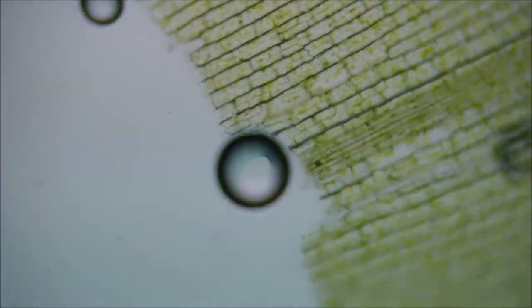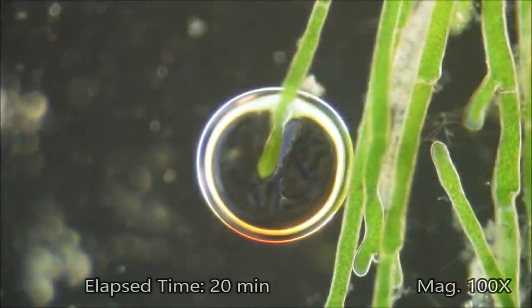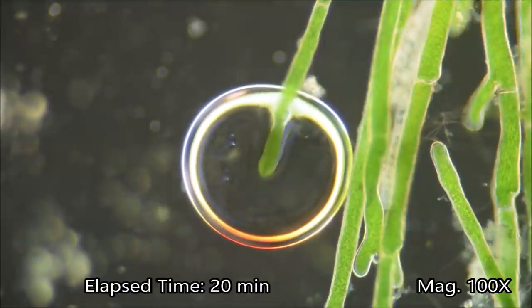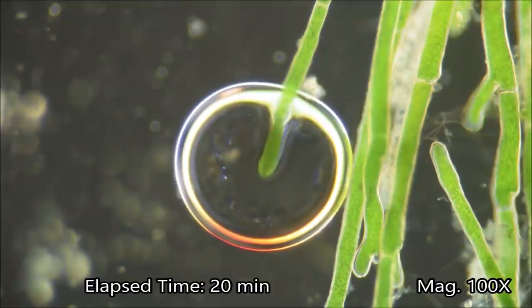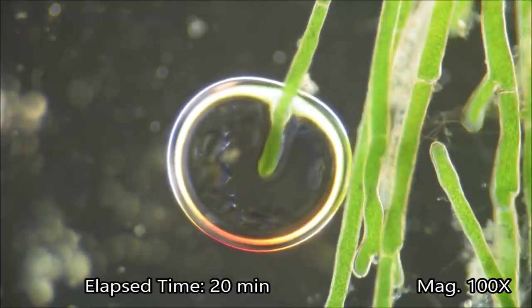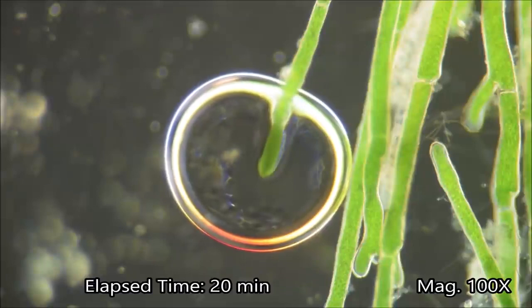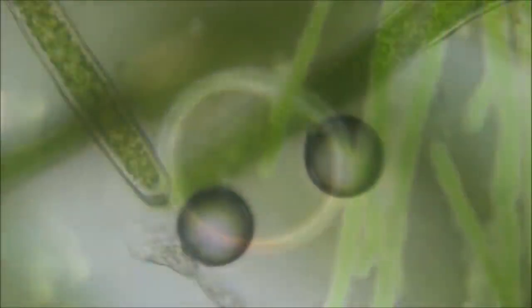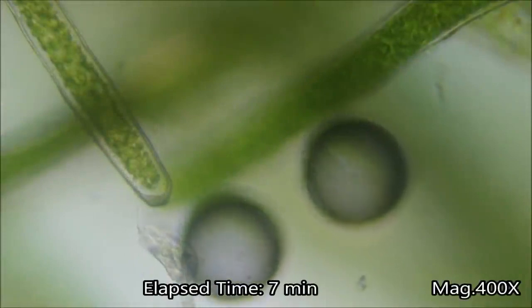We see a lot more oxygen bubbles than carbon dioxide bubbles for a few reasons. Carbon dioxide, or CO2, is more soluble than oxygen in water. This means carbon dioxide dissolves in water, similar to how salt dissolves in water. So when oxygen levels start building up in the water, these oxygen bubbles form more than carbon dioxide ones do.